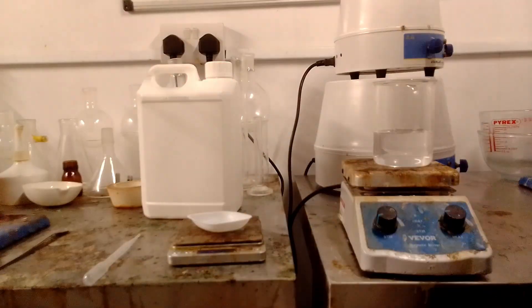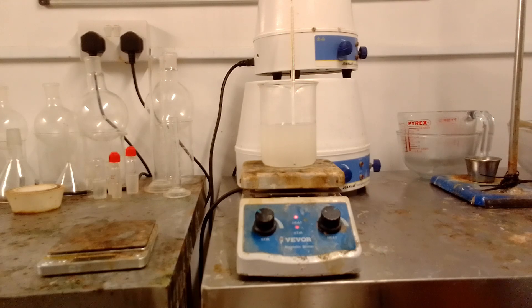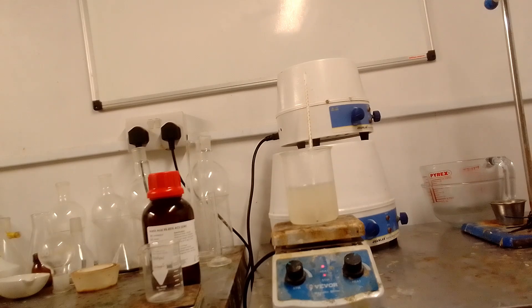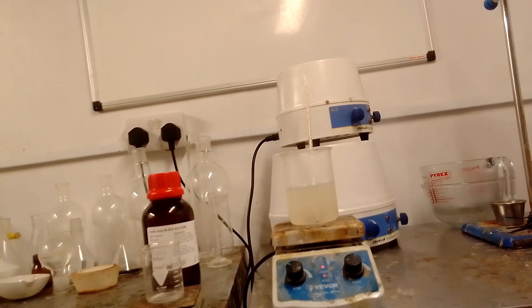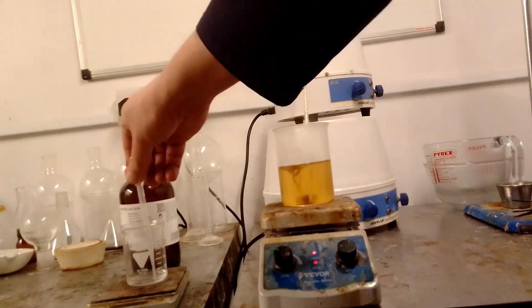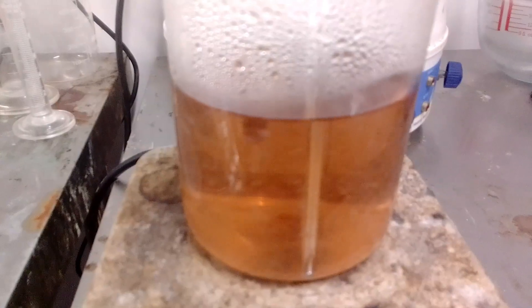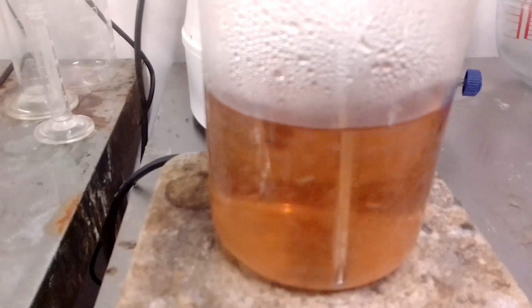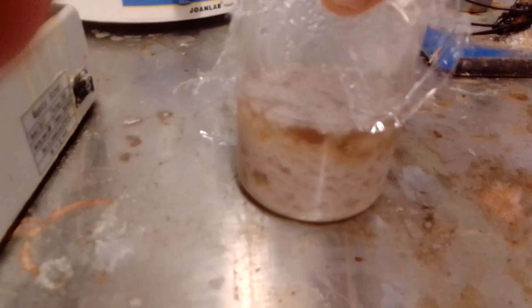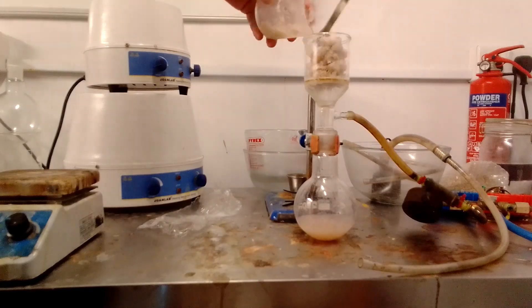Water was weighed into a beaker and caustic soda was dissolved in it. Methyl anthranilate was added to the mixture and heated with vigorous stirring. Over around 20 minutes as the temperature approached 80 degrees, the mixture slowly turned clear as the ester was hydrolysed into sodium anthranilate. Once it was completely clear, the temperature was held at 80 degrees for a minute, then glacial acetic acid was added, causing it to darken. The temperature was held at 80 degrees until solids started appearing at the surface. The heat was removed, the mixture cooled to room temperature causing the product to precipitate, then cooled in the fridge overnight. The product was recovered on the pump as 32.2 grams of very fine off-white needles.